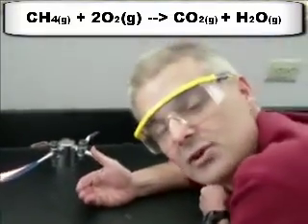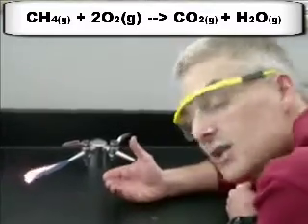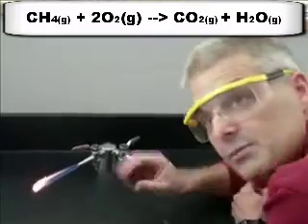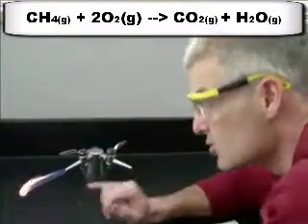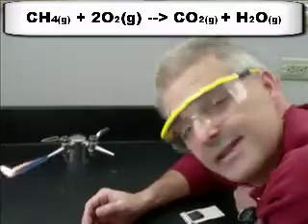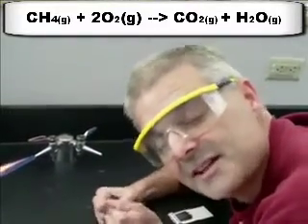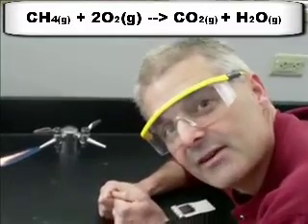This is the type of reaction called a combustion reaction. A CH or a CHO compound, this is CH4, so it's a CH compound, reacts with the oxygen, which is here in the air, to produce carbon dioxide, water, and heat. And I could warm my hands from this or set my face on fire like that student almost did, but I screamed loud enough that he stopped.